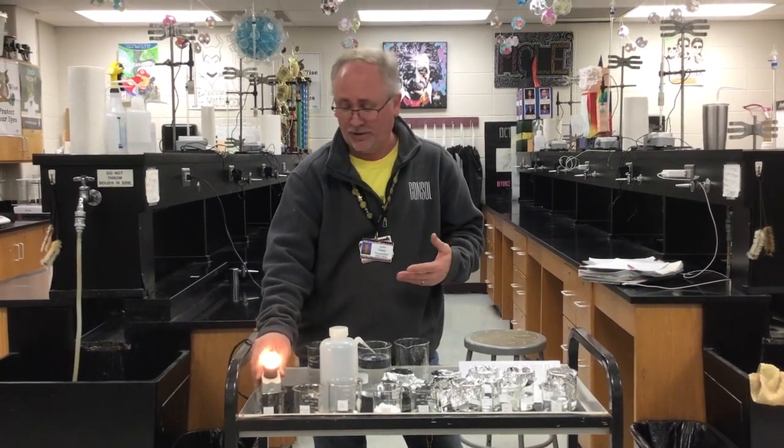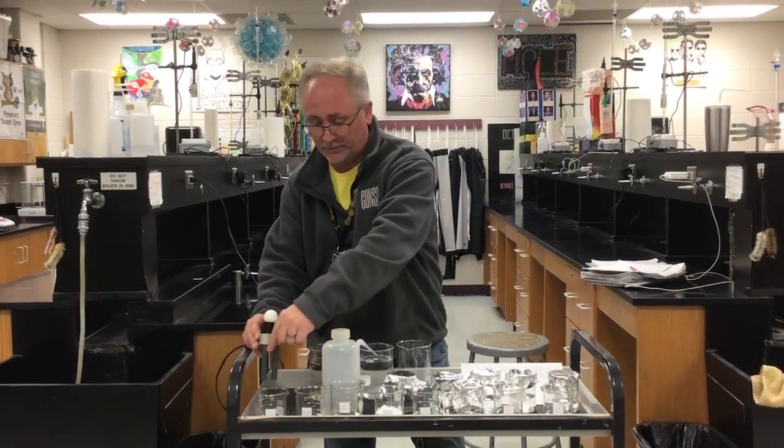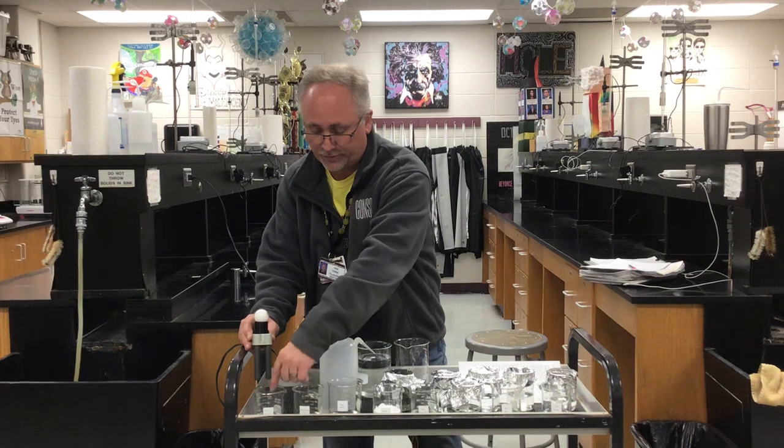I can't hear you. So I'm guessing you said it lit up. So that means that it's an electrolyte. The electrons are being transferred from one terminal to the other terminal through the solution.